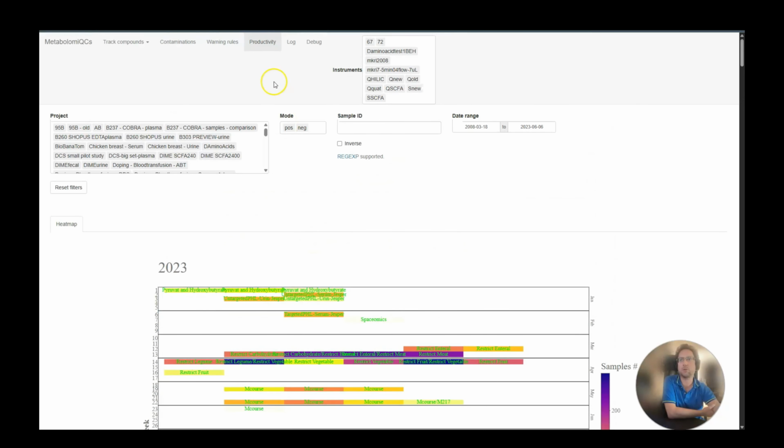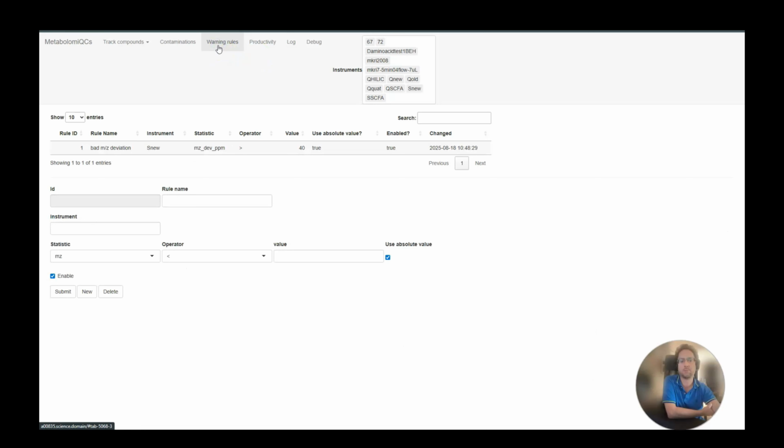Then we can move on to the Warnings tab. Here's where you set your own limits. For example, here it is set to email me if the MZ deviation goes above 40 ppm. But you can set limits based on any of the statistics. So this is your safeguard. To detect MZ accuracy issues, you would not need to check manually. The system will notify you of the problem.